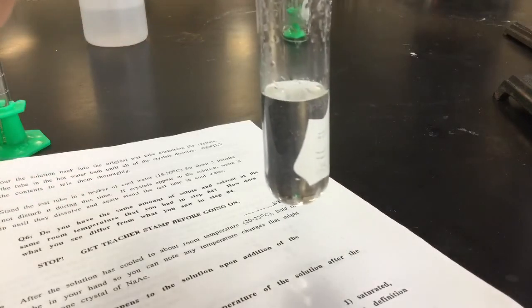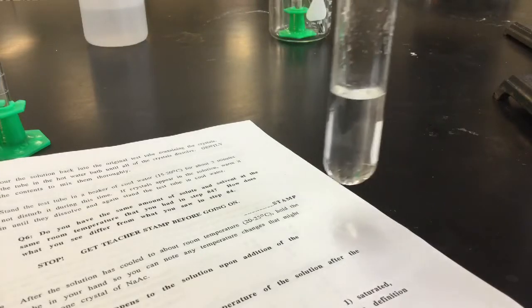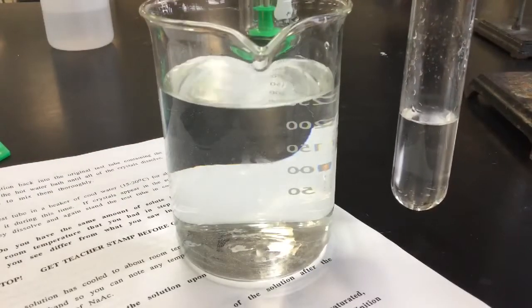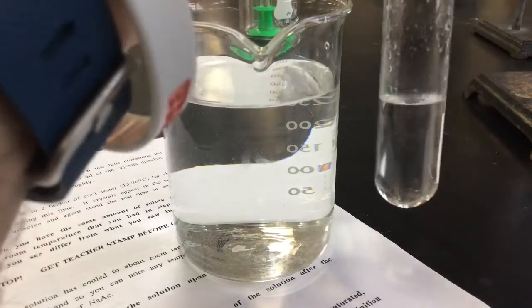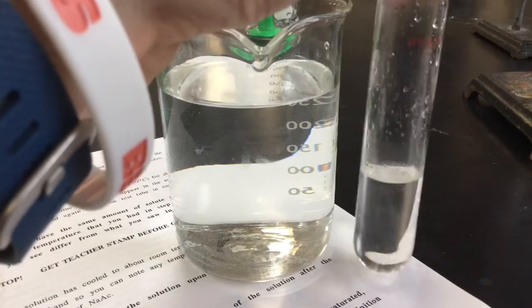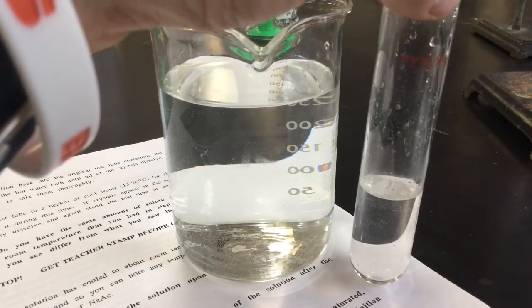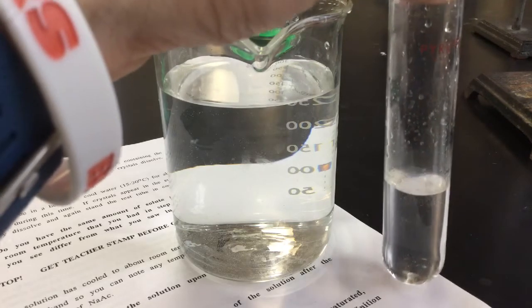We're going to trick it even more by cooling it down further, so we're going to get an icy water bath going. I don't want to put it straight into cold water right away because the glass from the test tube could shatter. I'll just let it cool in the air for a couple of minutes and hold it steady. So let it sit for about a minute or two and be gentle so you don't disturb it.